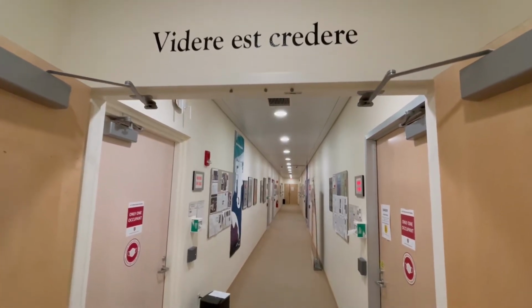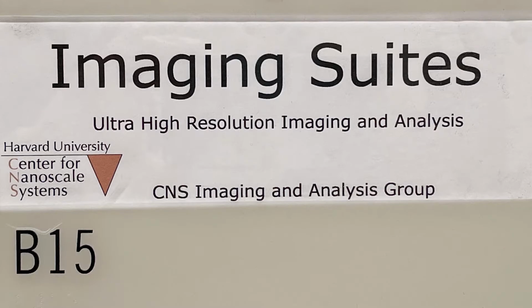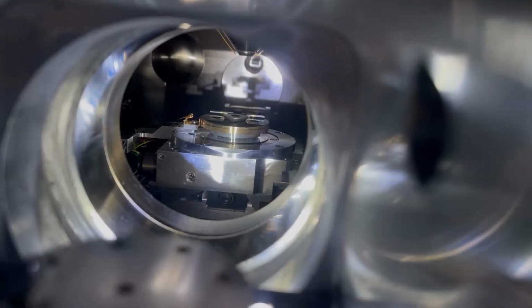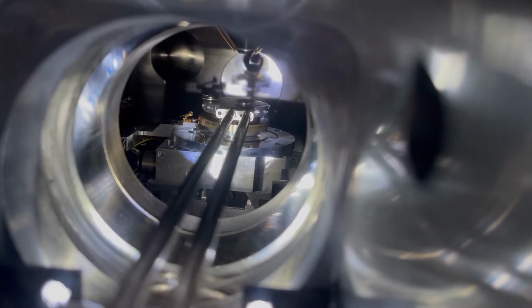Welcome to this overview of the Centre for Nanoscale Systems' Imaging and Analysis facility. Over the next few minutes, we'll give you a taste of the types of analyses that are performed at our centre.